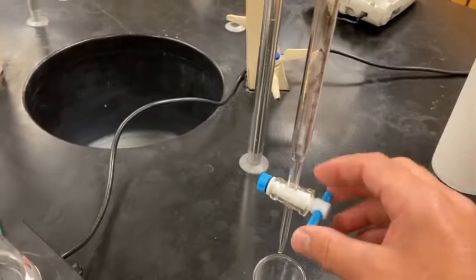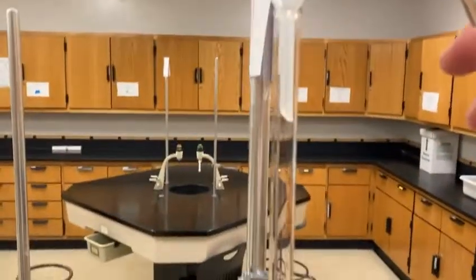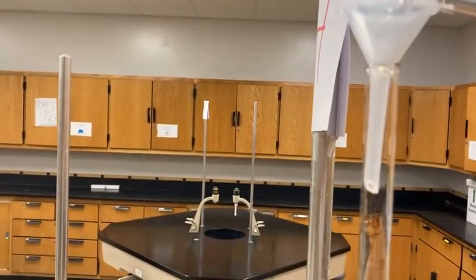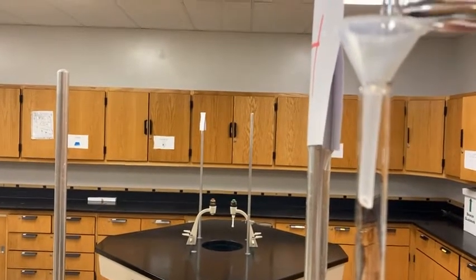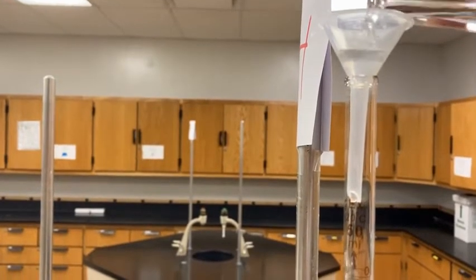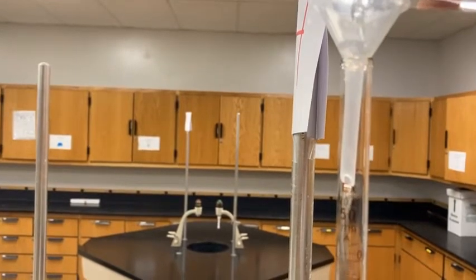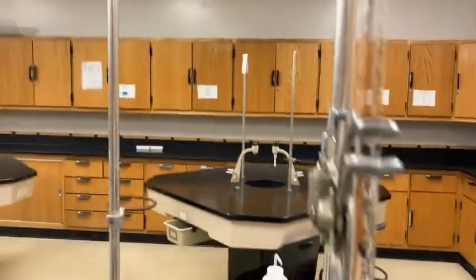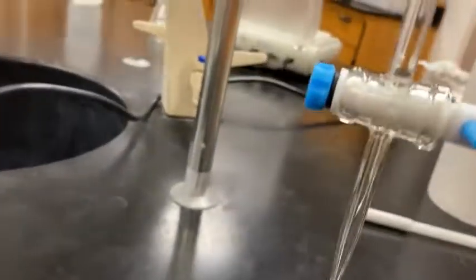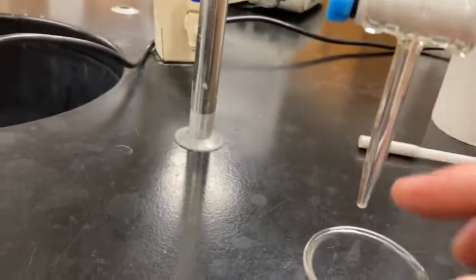So I'm making sure my valve is closed. I'm going to take that solution and I'm going to add it. I have a little funnel up here that makes things a lot easier. I'm going to add that into my burette and let it fill up from bottom to the top. And to make sure we have an exact volume when I go to record it, I want that base to actually go, I'm going to drip some through so it comes out the bottom, so it fills all of this space up with base also.